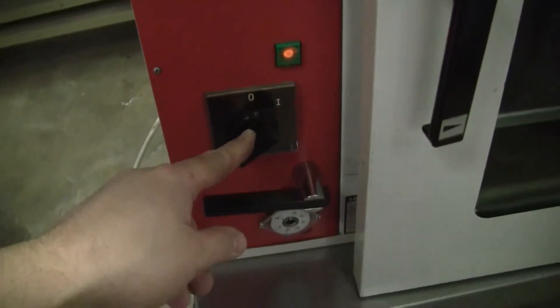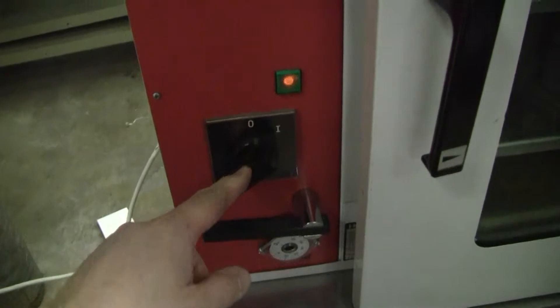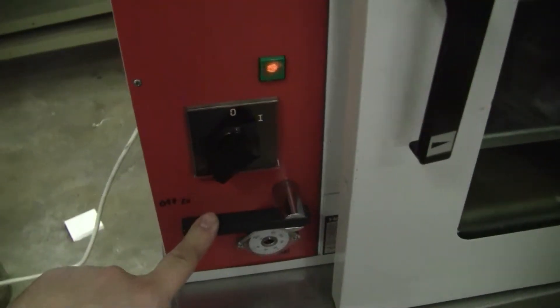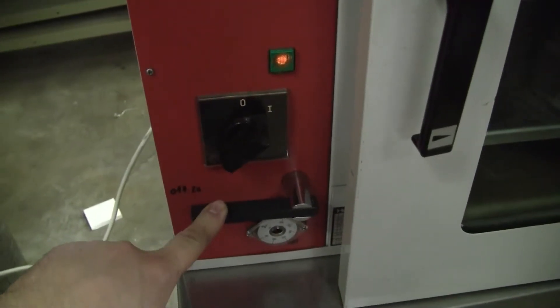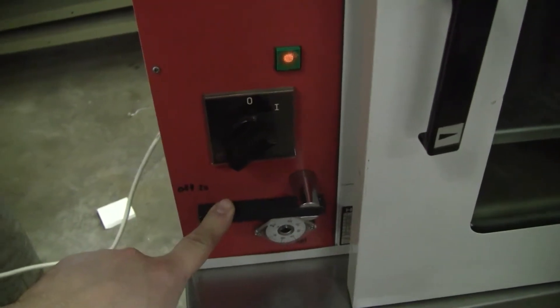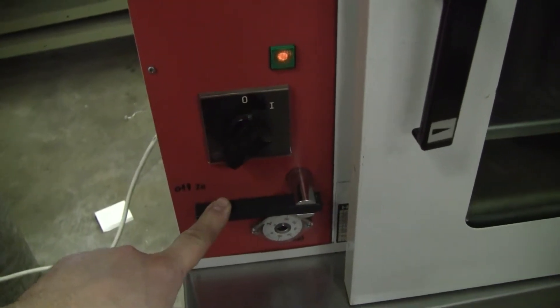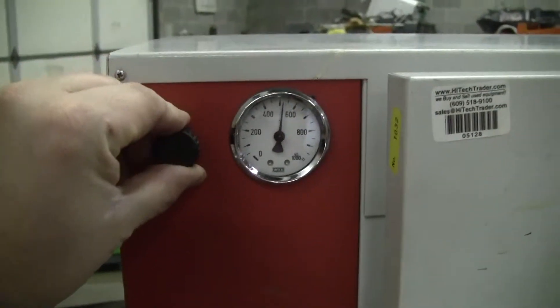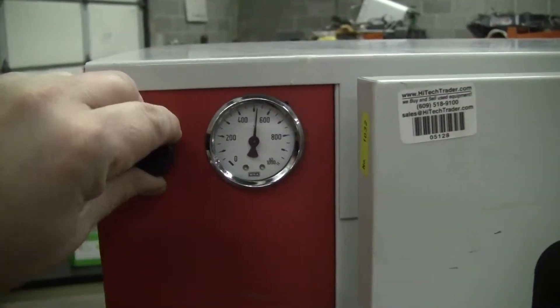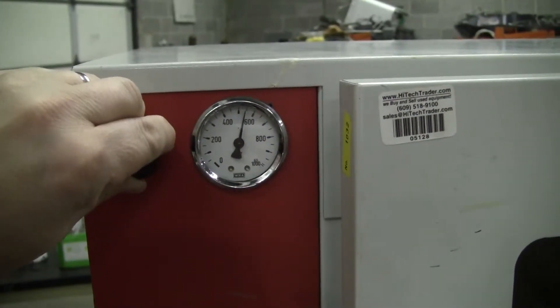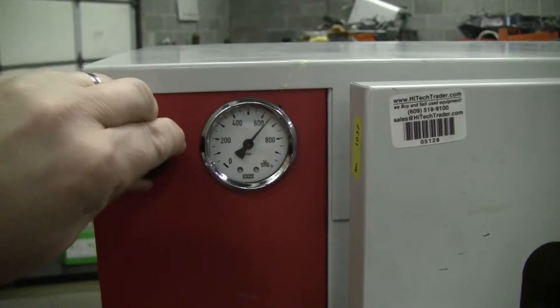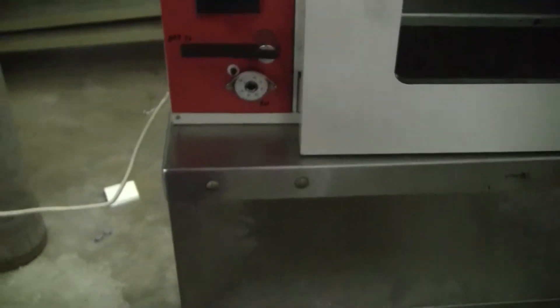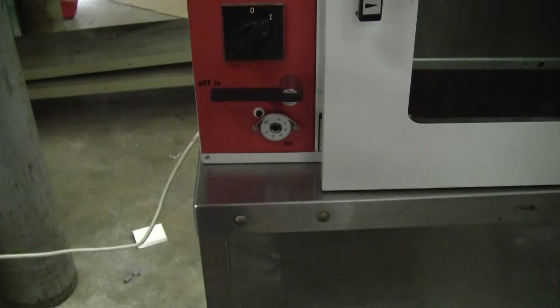Power on and off. This is your vacuum in shutoff valve. Your relief valve is here. I'm just going to release it a little bit. You can see it did that. And we have an over temp down at the bottom.